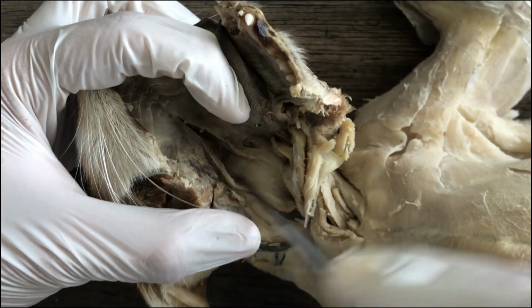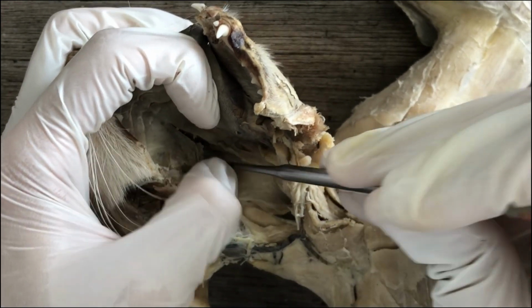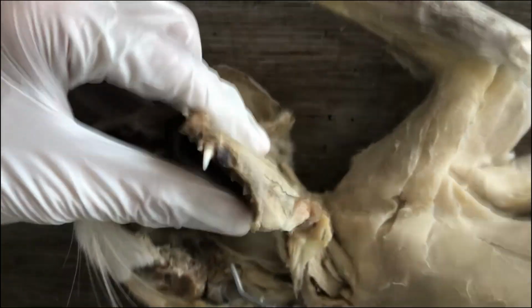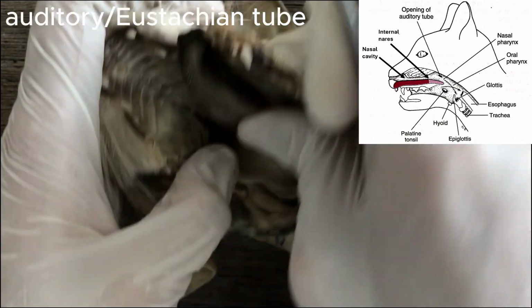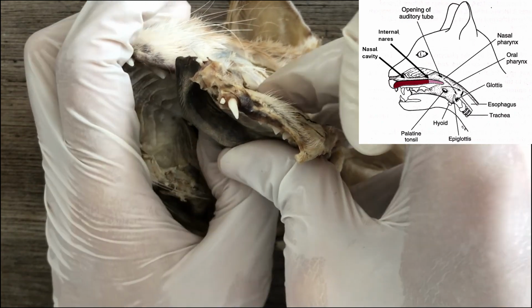And if you open the nasopharynx, you should be able to see a paired slit, which should indicate the location of the auditory tube canal, or the eustachian tube, which links the middle ear cavity into the pharynx.